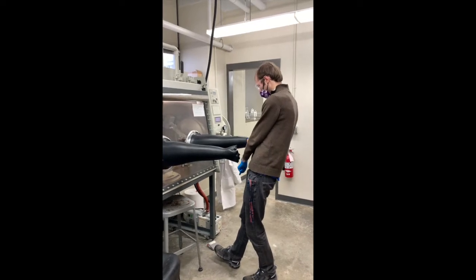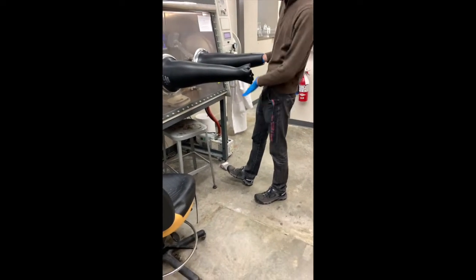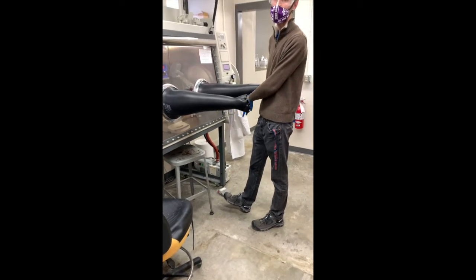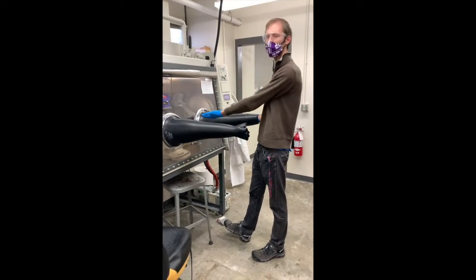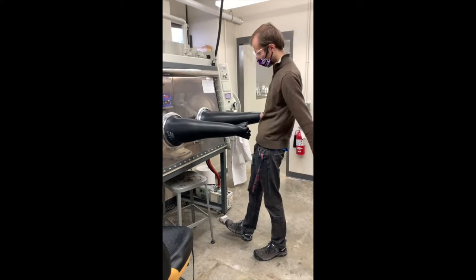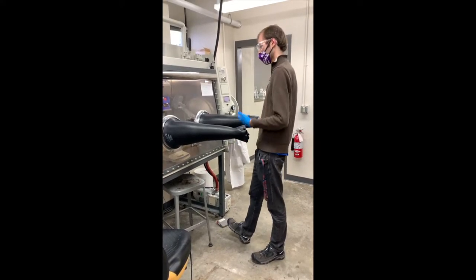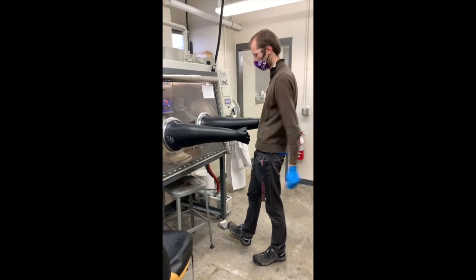I'm going to use the foot pedal down here to reduce the pressure in the box so that I can then push my arm in without raising the pressure too much. So if we look at this pedal, it's not very obvious, but it actually has two sides on it. If you push your foot on the left side, that will reduce the pressure inside the box. If you push your foot on the right side, that will increase the pressure in the box. So right now, because I'm going in, I'm going to reduce that pressure.